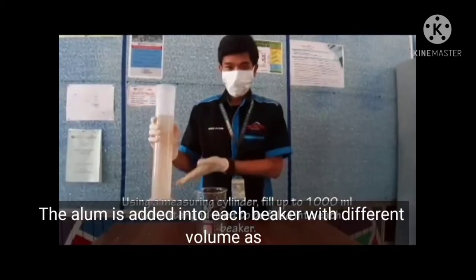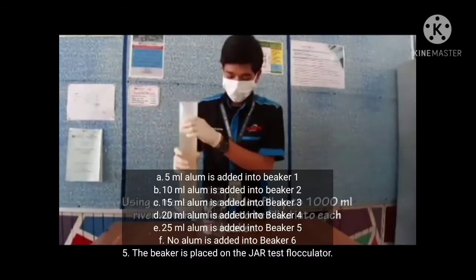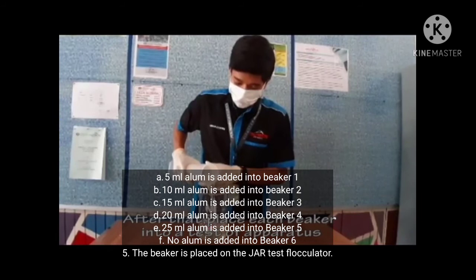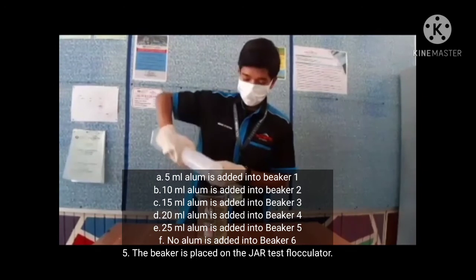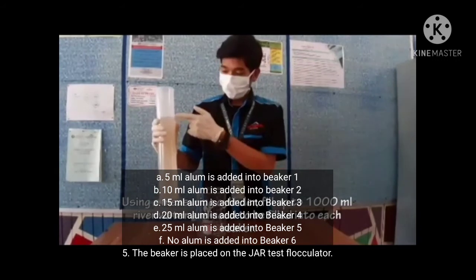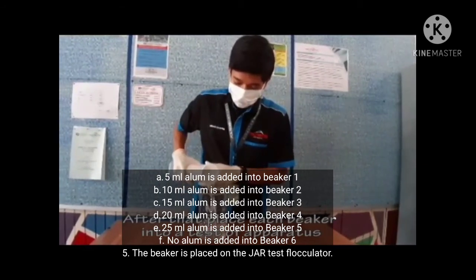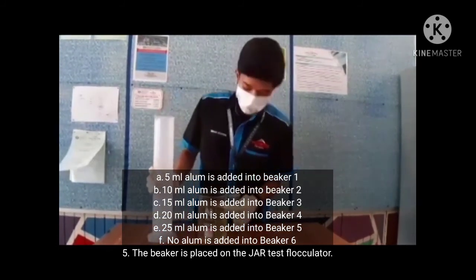The next procedure is number 4. The alum is added into each beaker with different volumes as follows. A. 5 ml alum is added into beaker 1. B. 10 ml alum is added into beaker 2. C. 15 ml alum is added into beaker 3. D. 20 ml alum is added into beaker 4. E. 25 ml alum is added into beaker 5. And F. No alum is added into beaker 6.